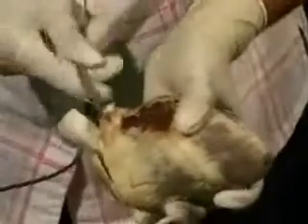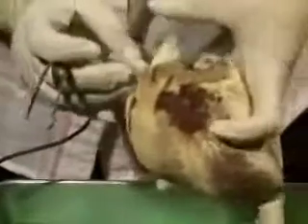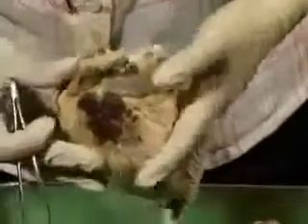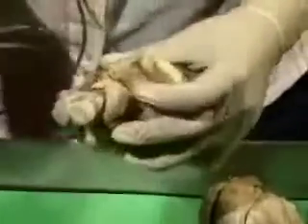Then exiting from the right ventricle is the pulmonary trunk, which you see here. This is the pulmonary trunk. It's an artery, so it has a thick wall. See that? It's a thick wall. This is the left ventricle, and exiting from the left ventricle is the aorta, which lies behind the pulmonary artery. So here it is. This is the aorta in which you have this. And then finally this is the left atrium, and opening into the left atrium you have these pulmonary veins. I've put these papers coming out, so these are the pulmonary veins opening into it.